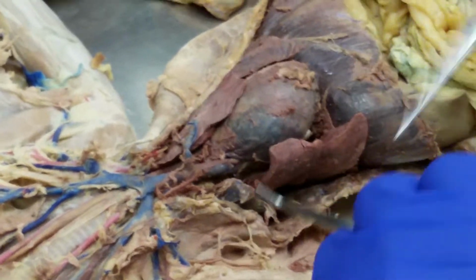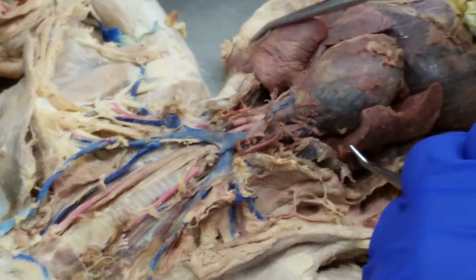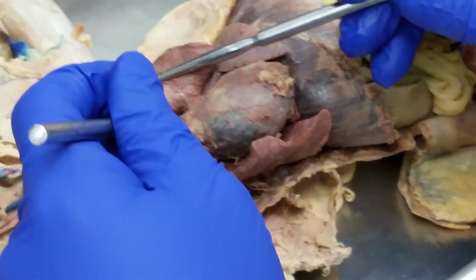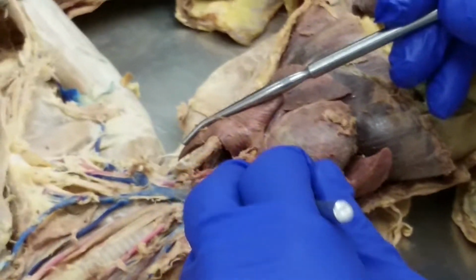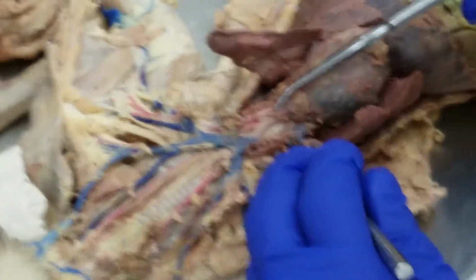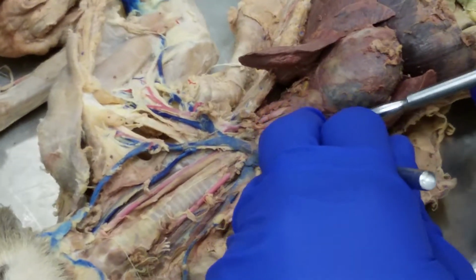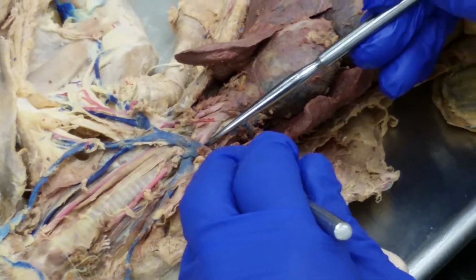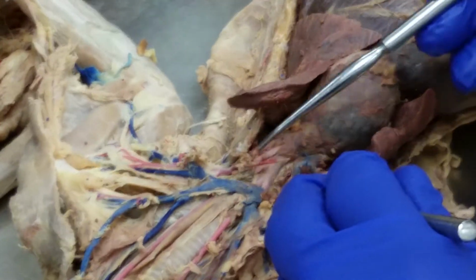Okay, and if you do this, we may have to clean this up a little bit. We have the aortic arch, which is this right here. Okay, and then it goes into the thoracic aorta descending. So the first branch on the aortic arch, you can see right here, right, is the brachiocephalic trunk. Okay, brachiocephalic trunk. So if I do this, right, this would be the right subclavian artery. Right subclavian artery. Do you see it?